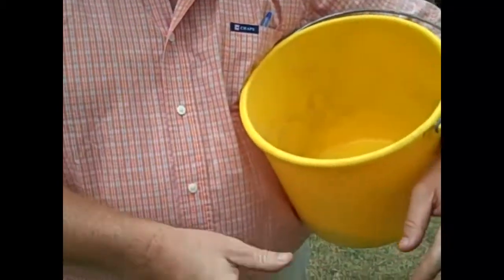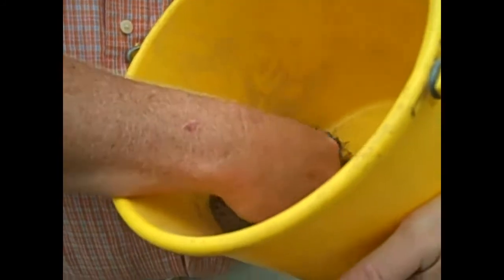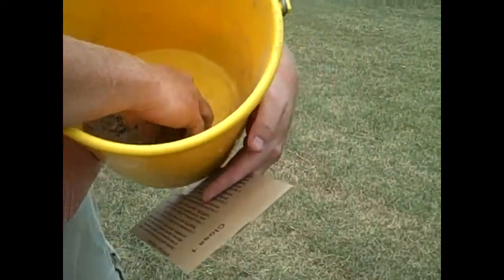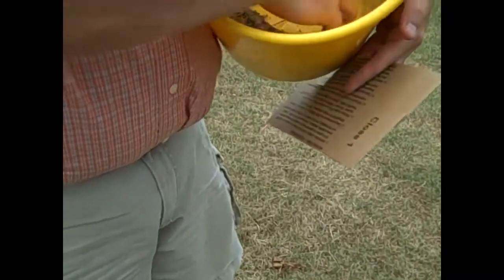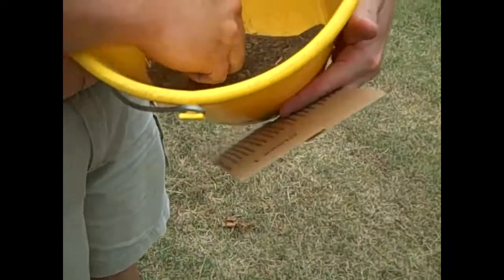The next step in the process is to get your box from the North Carolina Department of Agriculture. Mix your soil — if you've got clods, try to break them up and mix it thoroughly. You've taken a sample from your representative area and you want to make sure the soil you put in the box is thoroughly mixed so that you get a good sample. If you get roots and bits of grass in it, just throw them out — we don't need that for the sample, though it doesn't really hurt to leave some in if you don't get them all out.